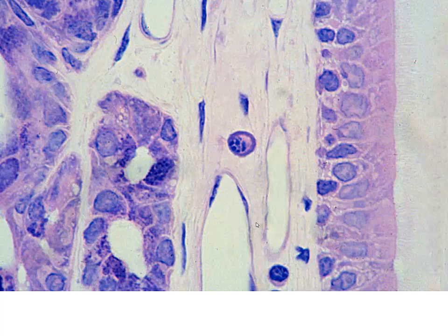Again, we've got more connective tissue. We can see our epithelium on the right in this location. This is going to be our pseudostratified columnar epithelium, and we do have cilia on the surface. You can see it very faintly. I wish we had a better, more contrasty view here, but we've got the cilia on the surface.